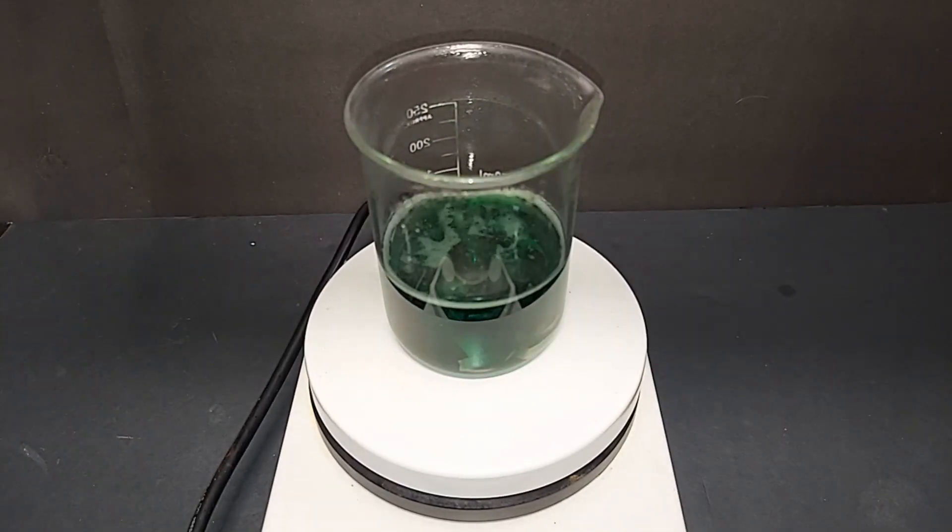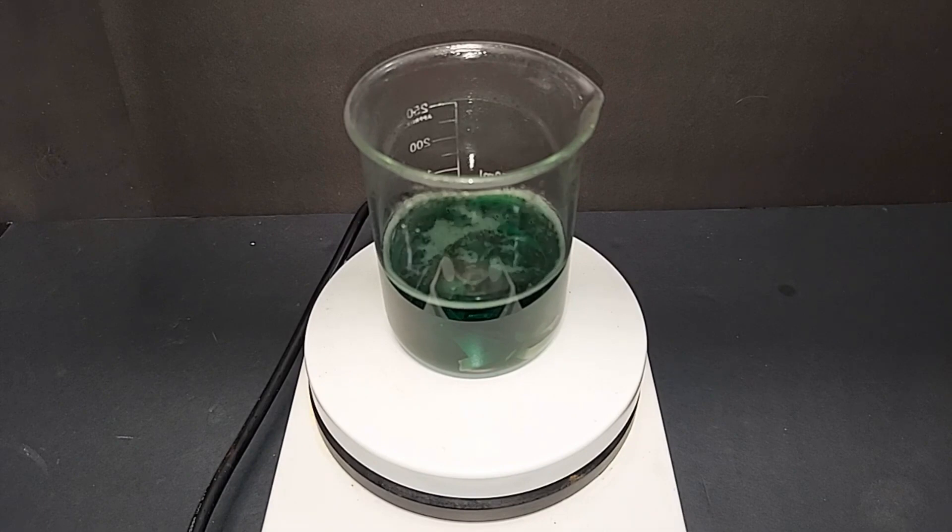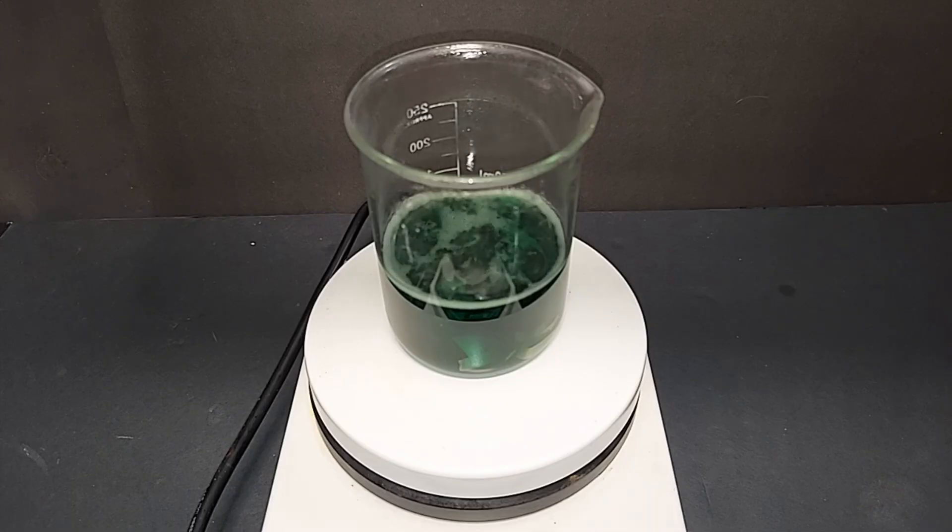It's been another 40 minutes. I added all of the 30% hydrogen peroxide, which was 50 milliliters during that time, and I've also added another 10 milliliters of the 31% hydrochloric acid.